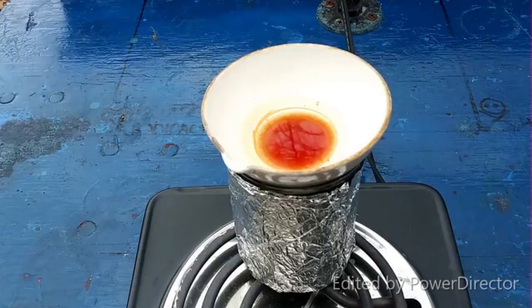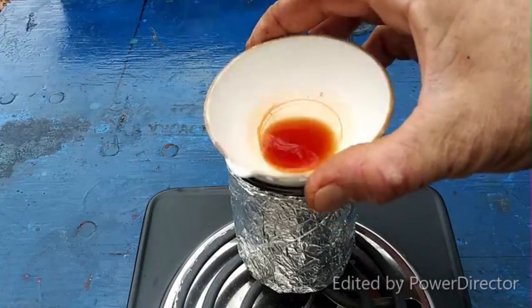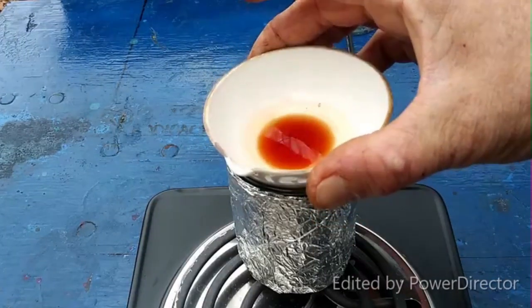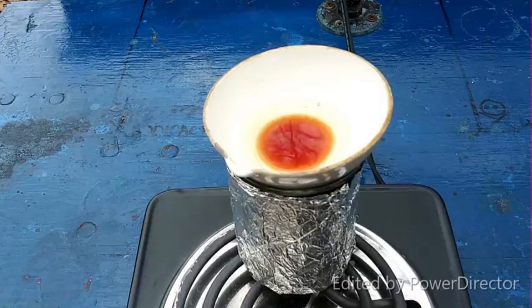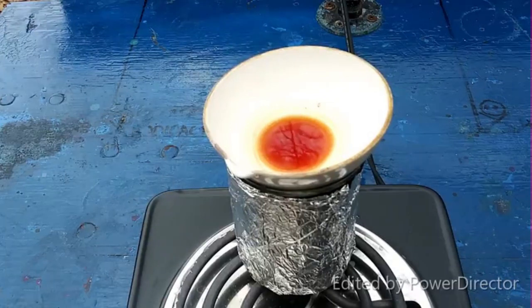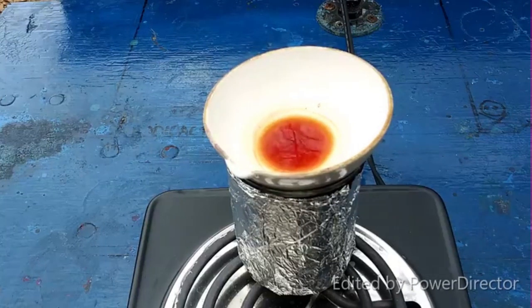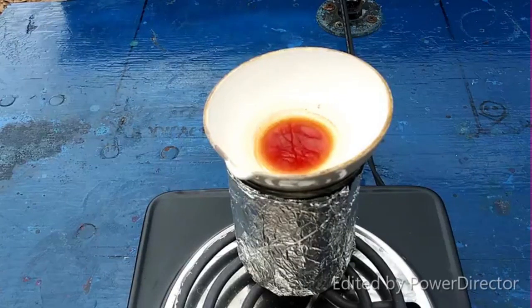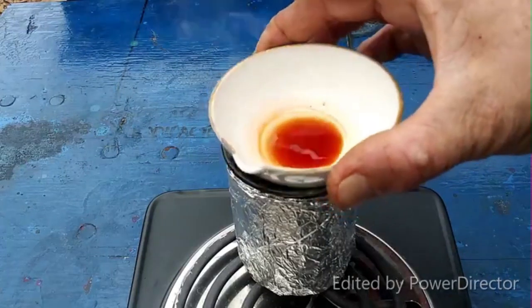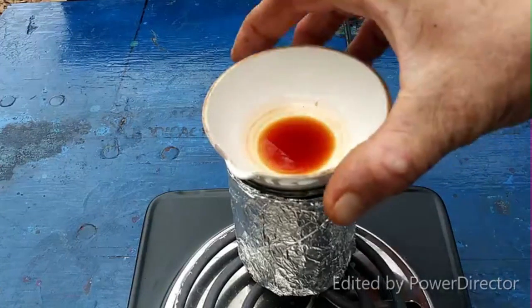This is really fascinating. The story just gets more and more interesting. This is the compound here - it's evaporating down and I'm getting a slightly orangeish, reddish solid off of this. You can see it forming as the liquid evaporates. This looks like an addition compound of thorium. It is even red like I thought it would be. This is not bromine in solution - it can't be. It's solidifying. I'm going to take it off the heat here.